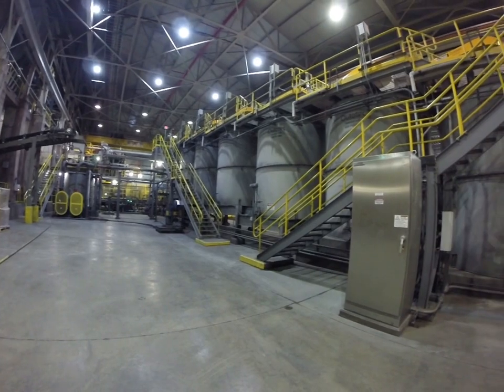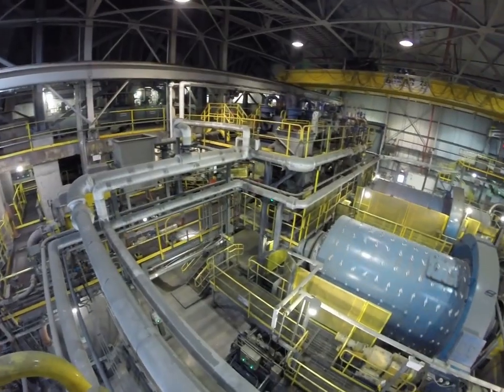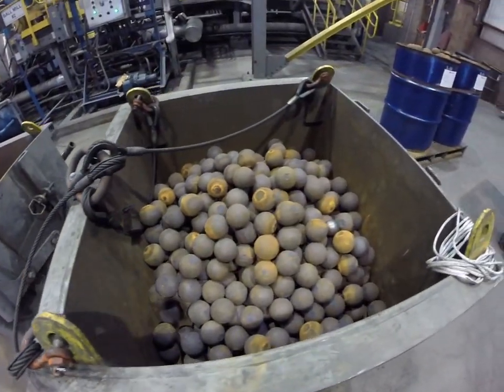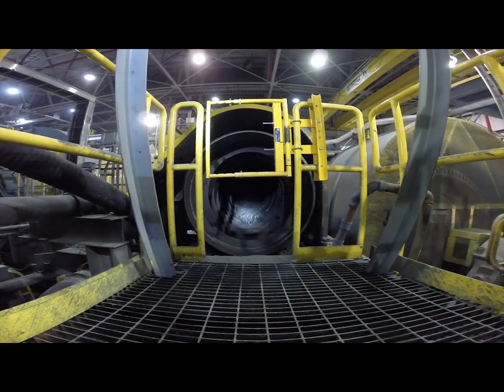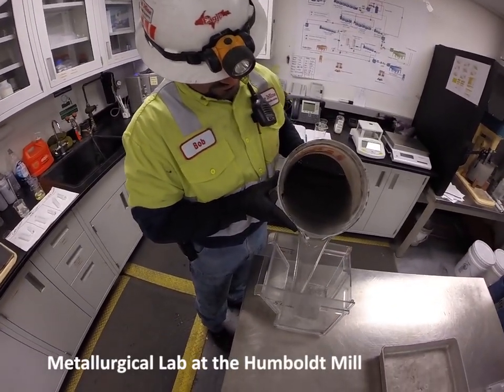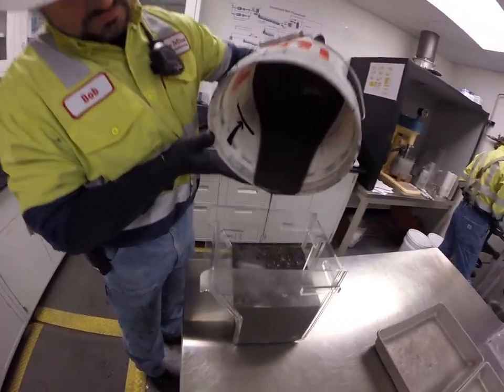So what we have to do is go out into the plant, and there you will find a ball mill, which is a huge tumbler that has steel balls inside that pulverizes all of the ore. Water is added to it, so we're taking a sample of what comes out of the mill, which looks a lot like dark, dreary water, and at the bottom there's a very thick layer of all the metal and material that's inside.